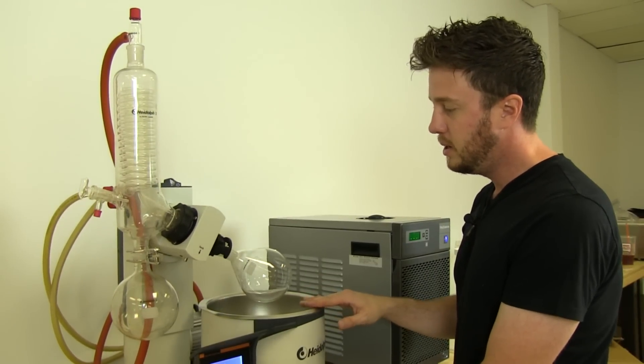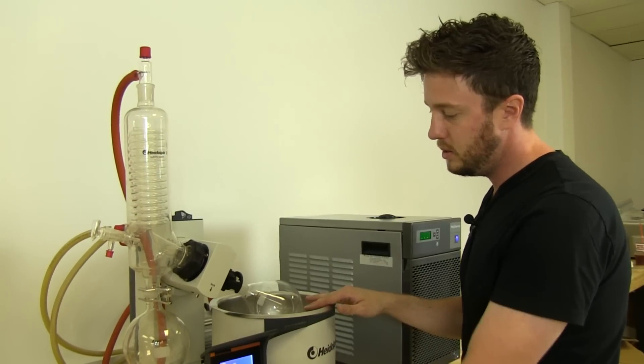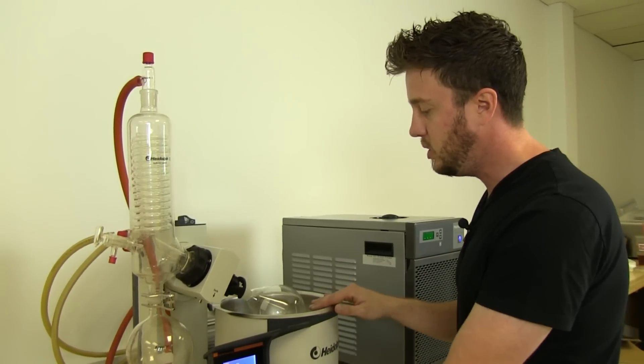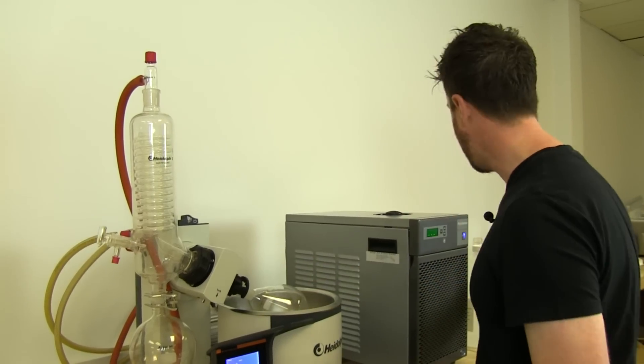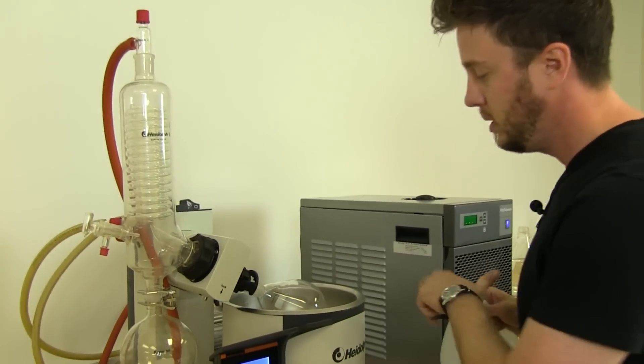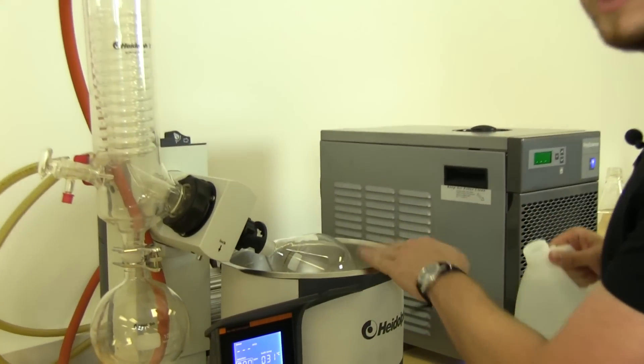So we have this arm that raises and lowers into the bath, and we have a 1,000 milliliter or 1 liter evaporating flask on here. I'm going to fill this reservoir with water.